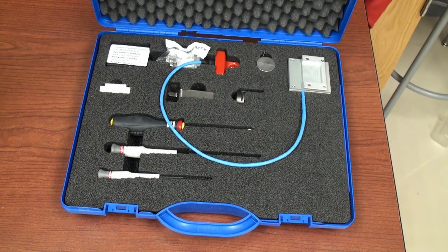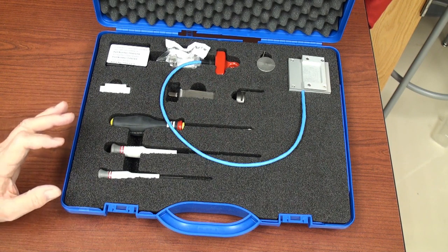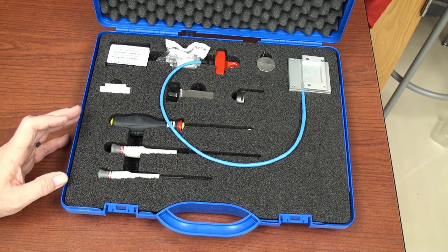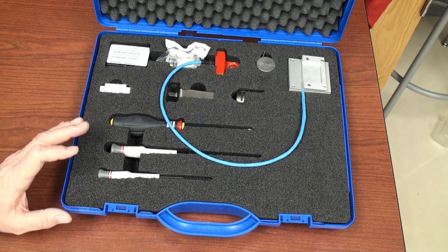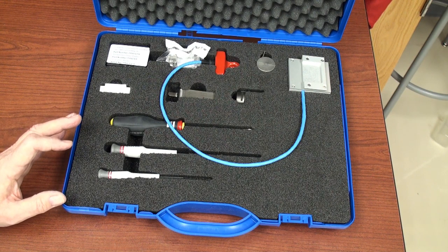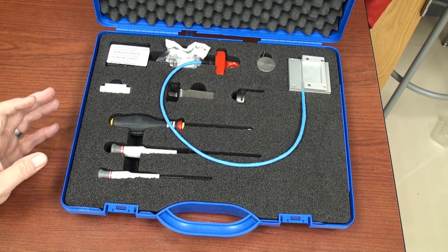There's a blue accessory box which comes with the instrument. It has all the tools and accessories you need to successfully set up and operate the SMZ2 slicer. I will point out some of these parts now, and you will see a closer view of these parts as the video unfolds.